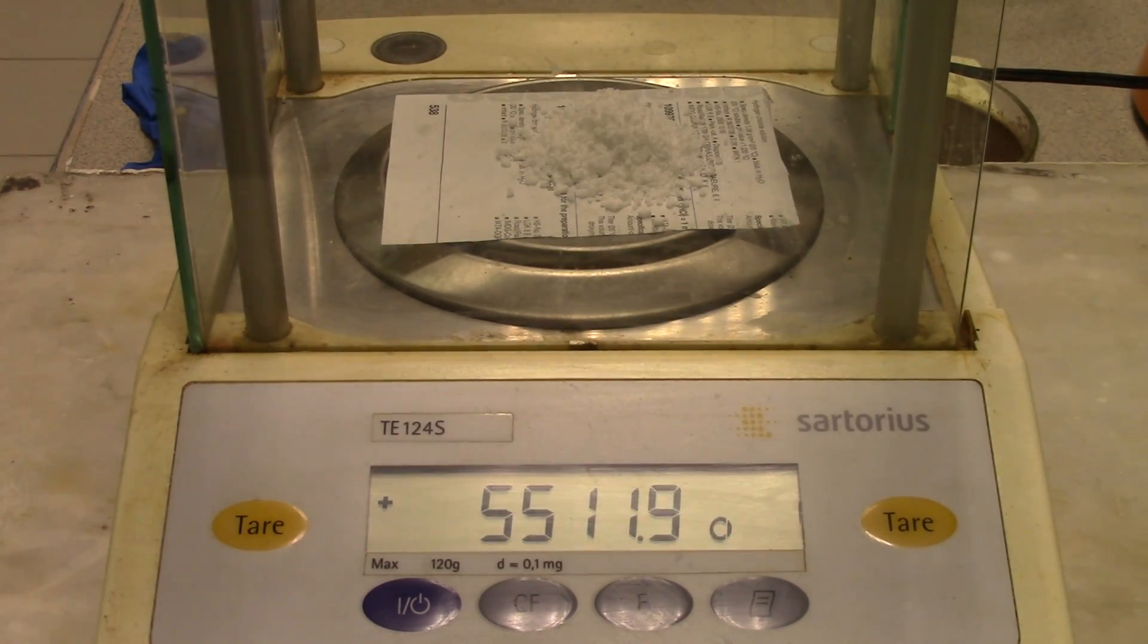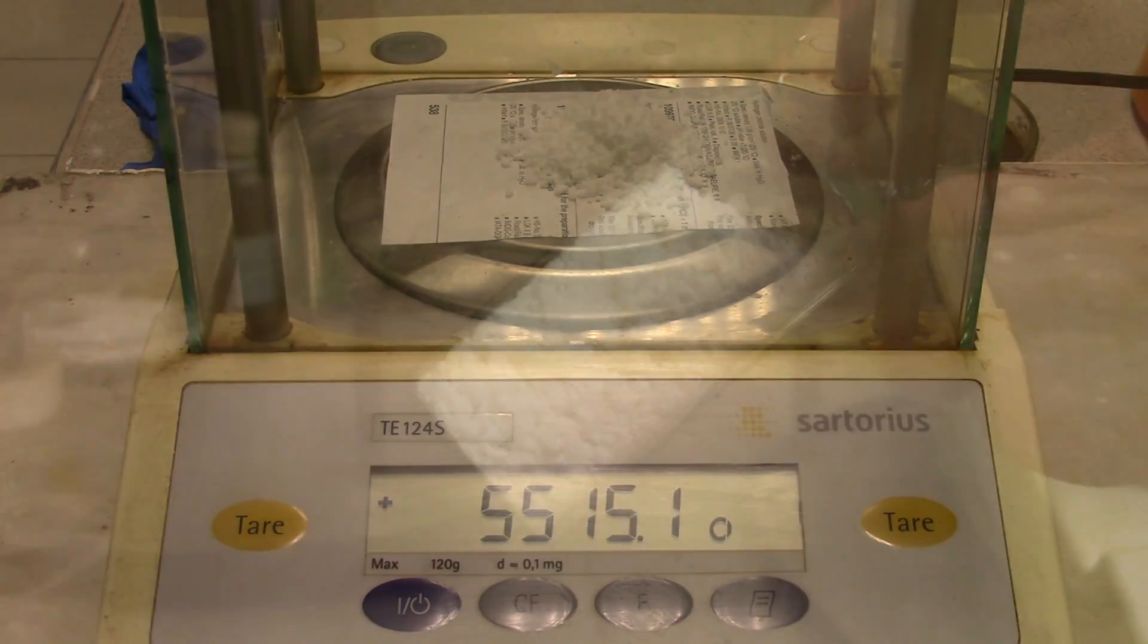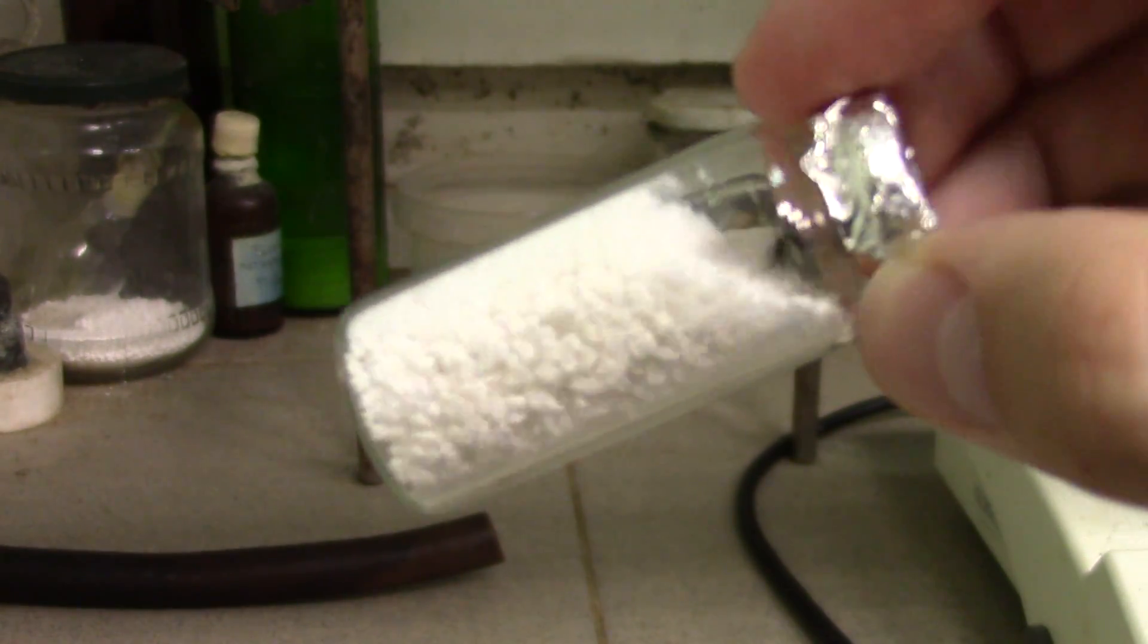Awesome. I have collected about 5.5 grams of pretty pure tetraborate. And it's white powder, around 61% yield.